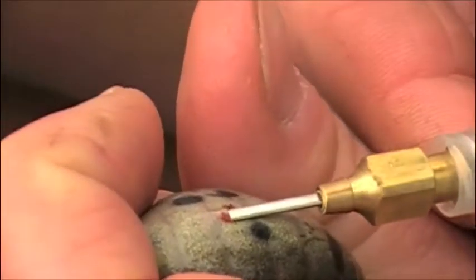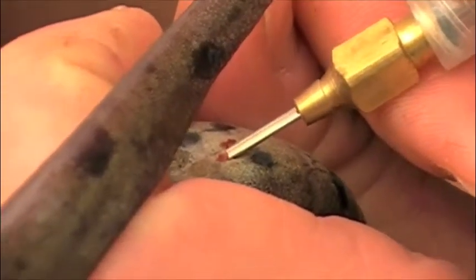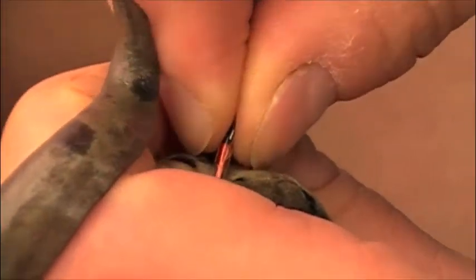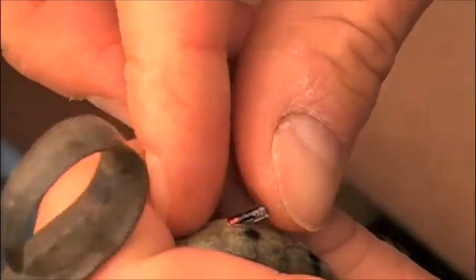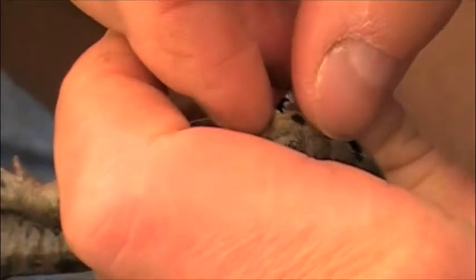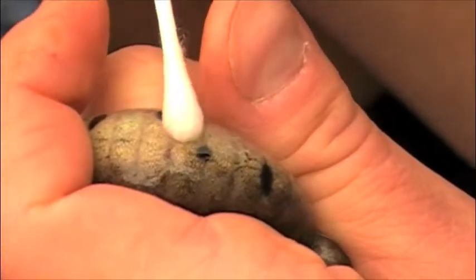Stick the flat needle in. Press it down in, and slide the pit thing in. There it goes. Sometimes it gets under the skin — you have to make sure it gets to the end of the body. And it's done. Voila.